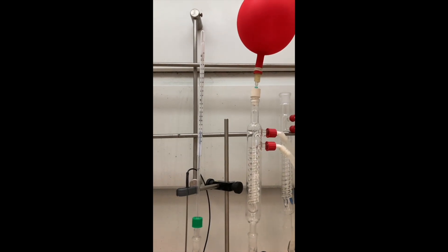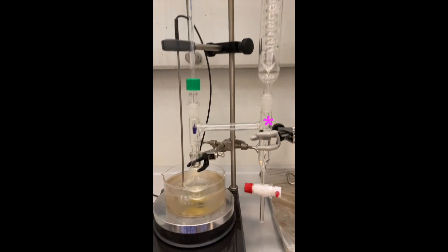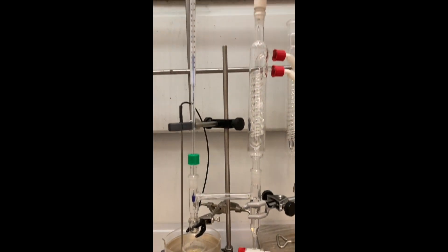Since toluene has lower density than water, it floats on top. And since the trap is filled with toluene, the excess organic solvent flows back into the reaction vessel, so the reaction mixture doesn't dry out.